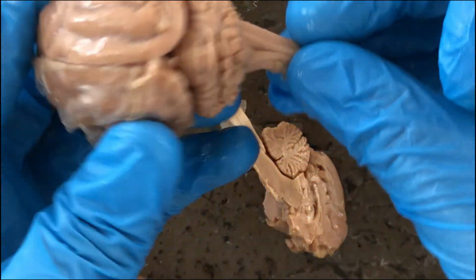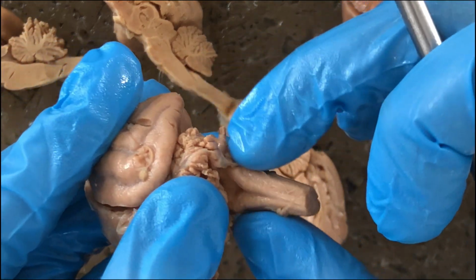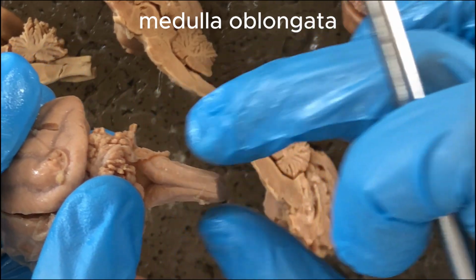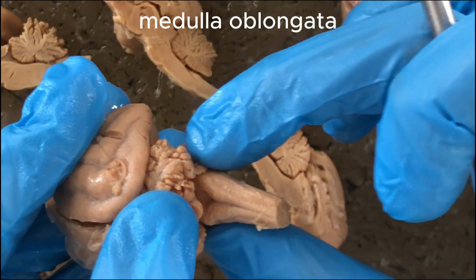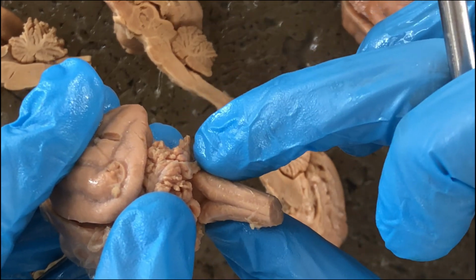And so cerebral hemispheres, cerebellum, and this one, the hind portion of the brain, is the medulla oblongata, which indistinguishably transitions into the spinal cord. But this more cranial expanded portion would be the medulla oblongata.